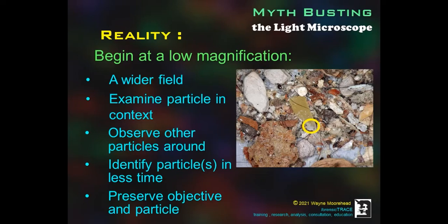Here we see the original particle and other particles around it. This appears to be from a construction site or other location where apparent drywall, wood, hot glue fragment, small rocks and minerals, possible insect parts, fibers, apparent metal fragments, and other materials, as well as hair, would be found.